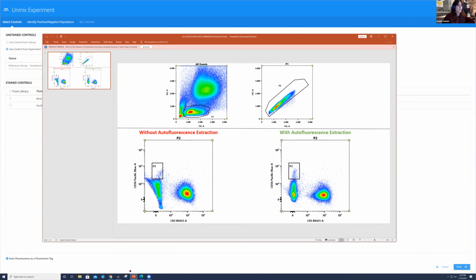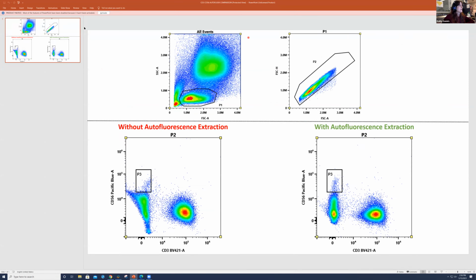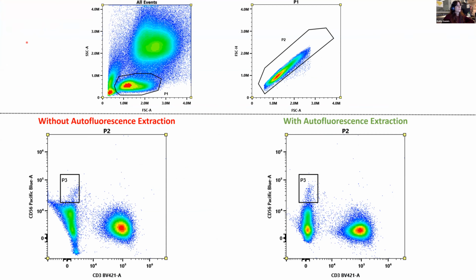But I do have the results here in PowerPoint. So if we go ahead and take a look, this is the result of looking at CD3 and CD56 without and with autofluorescence extraction, okay? I showed you how to do it in the software by just checking that button when you do unmixing. But what you see here in a CD3 and CD56 combination, when we're gating on just this lymphocyte population, is that the negative population is a bit skewed, and visually it's a little bit hard to set some gates, and it might not be the best representation of the data when we're looking at the negative, okay?